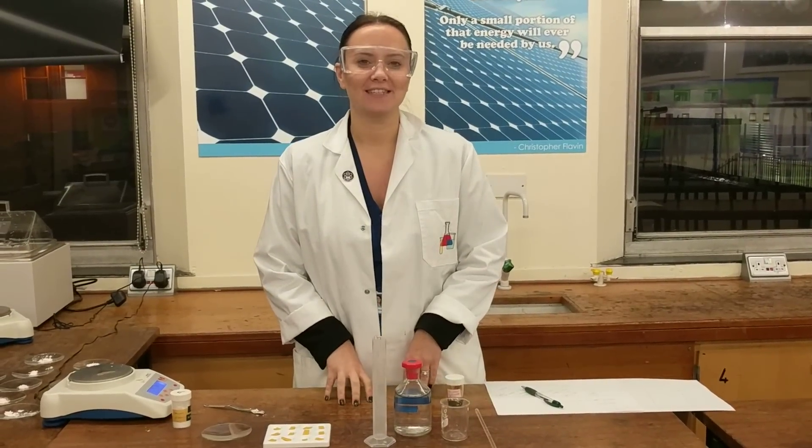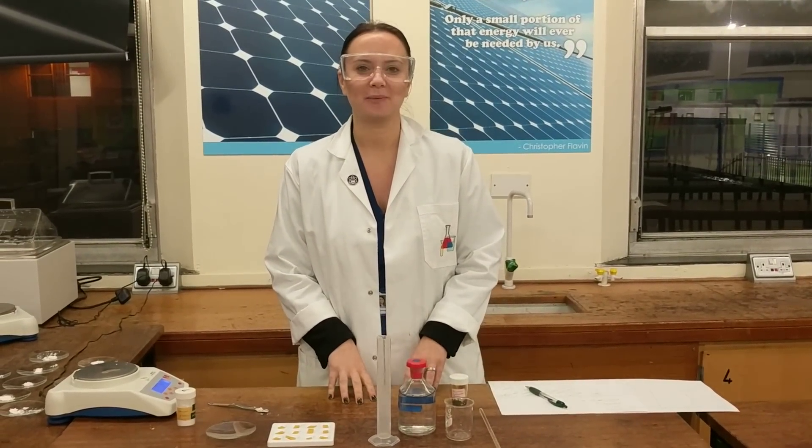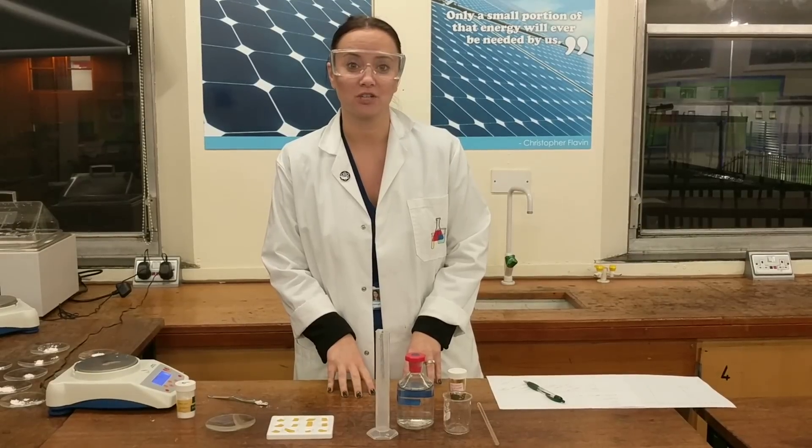Today we're going to be looking at investigating the pH change when you add powdered calcium hydroxide to a fixed volume of hydrochloric acid.